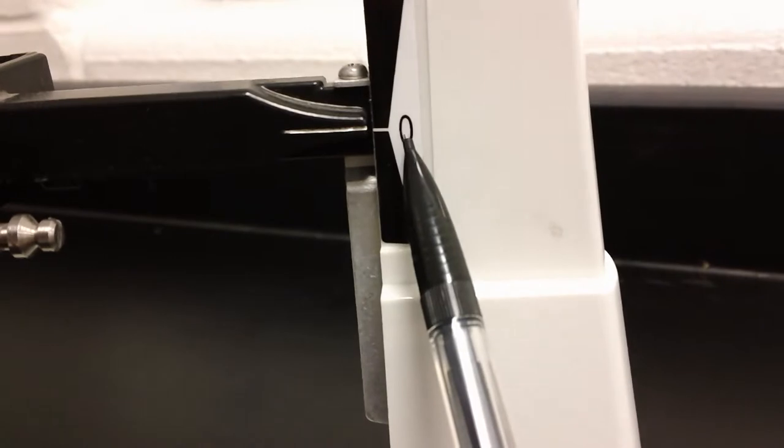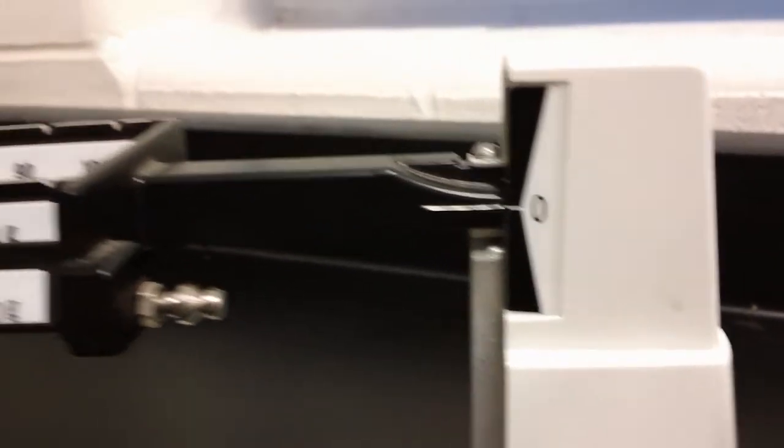We know this because this line right here will line up with this little tick mark at the zero, and that tells me that my balance is actually ready to use.